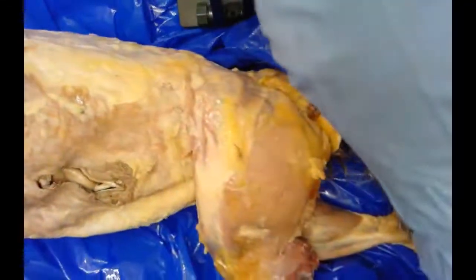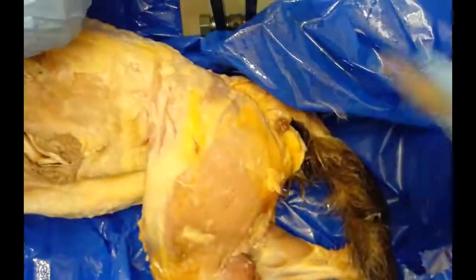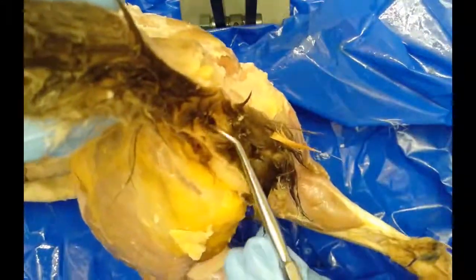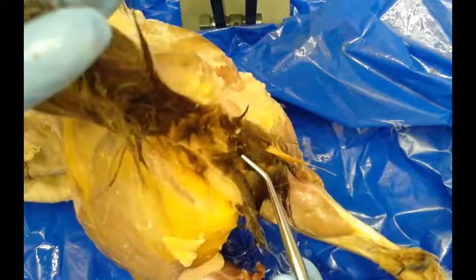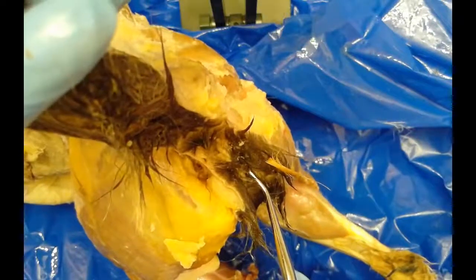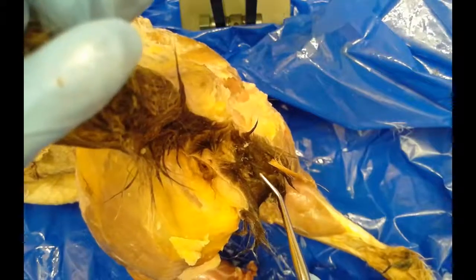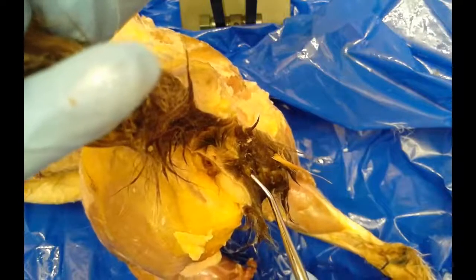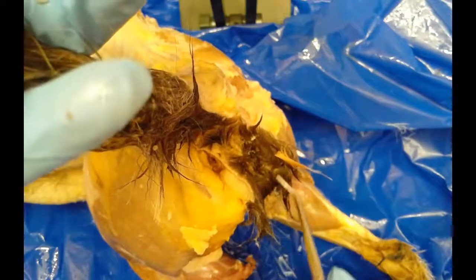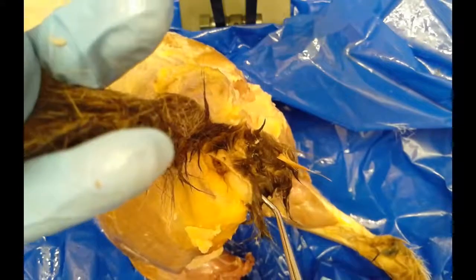Moving a little further down towards the rear to check out the tail region — this is a female, so when I lift up the tail, you can see this opening here, which is the entrance into the anus. Just posterior to that is another entrance — that's the urogenital opening, the entrance into the vagina for the female, surrounded by two flaps called the labia majora. In a male, they would not have that opening; they'd have two scrotal sacs externally.